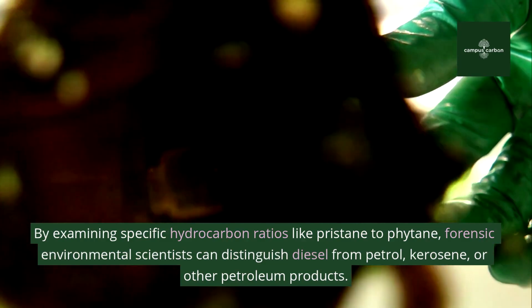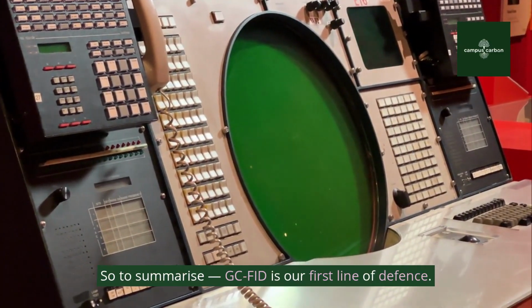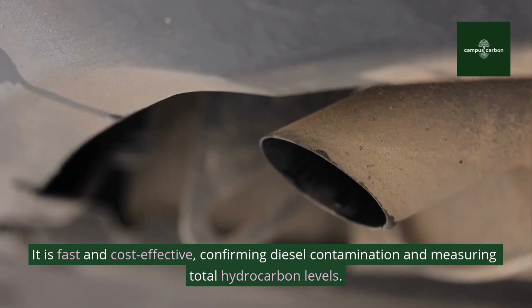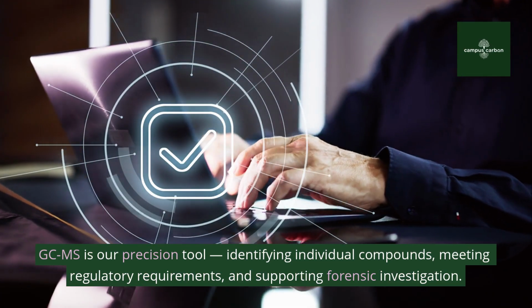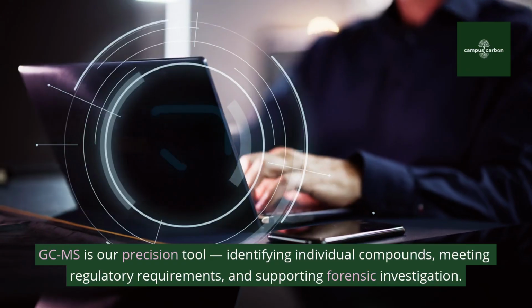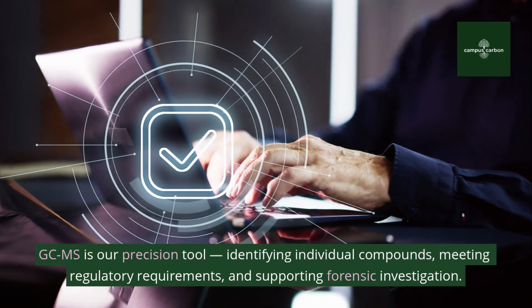So to summarize, GC-FID is our first line of defense. It is fast and cost-effective, confirming diesel contamination and measuring total hydrocarbon levels. GC-MS is our precision tool, identifying individual compounds, meeting regulatory requirements, and supporting forensic investigation.